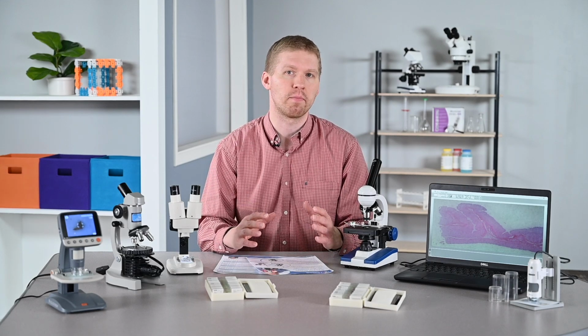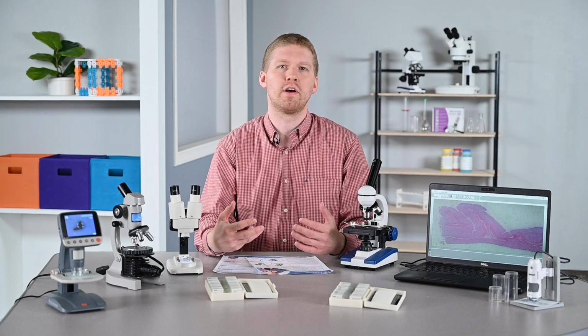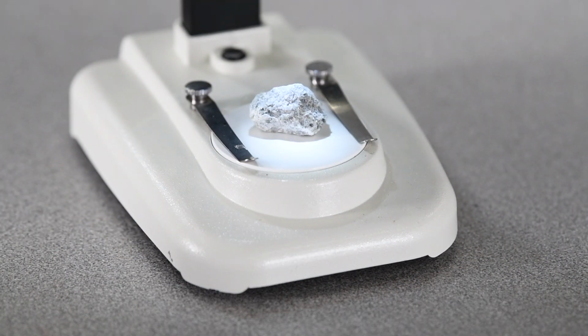If you don't know the difference, a compound microscope has higher magnification, which allows you to see very tiny little things much clearer. You're able to see things on a slide that are sometimes not even visible by the naked eye. Whereas a stereo microscope, sometimes referred to as a dissection microscope, still allows you to magnify an object, but they're generally larger, like rocks, like we see here.